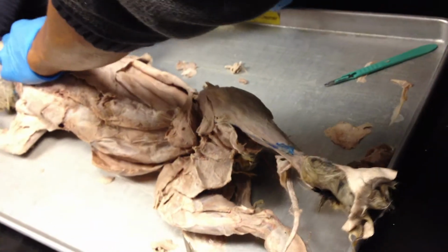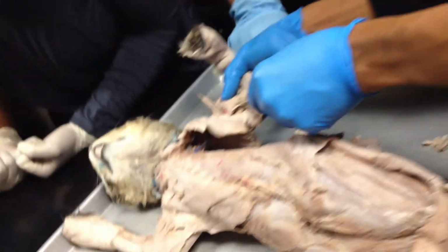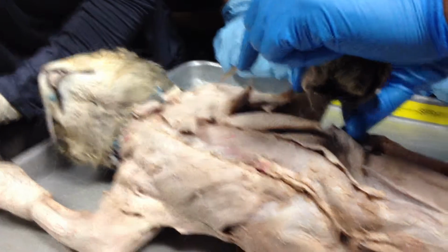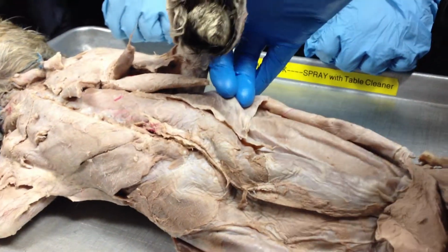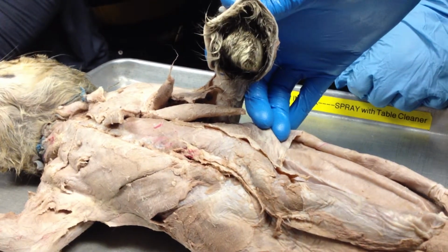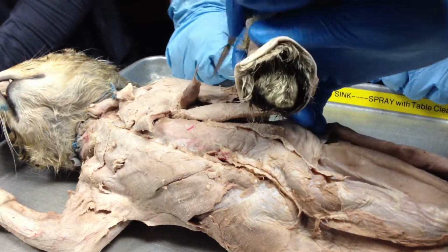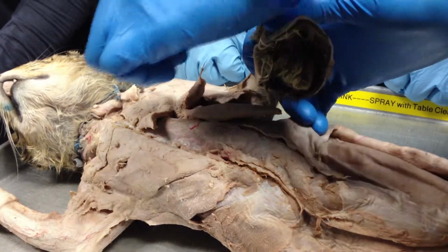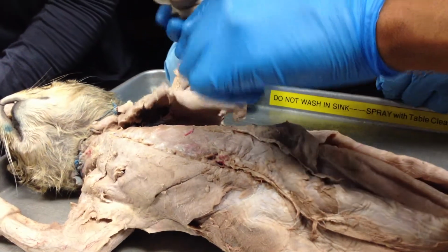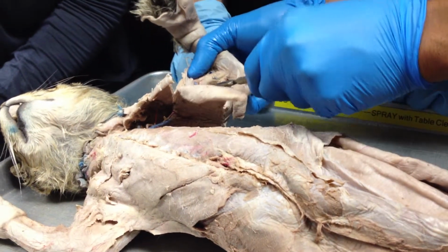And then the forelimb, 2 muscles we need to identify here, and that would be not the superficial one here. These are all part of the deltoid. But when it comes to the cat, cats have more muscle than human because their muscles separate into smaller muscle. So the deltoid has 3 different names. And so this would be all part of the deltoid muscle, and then it attaches to the humerus down here.